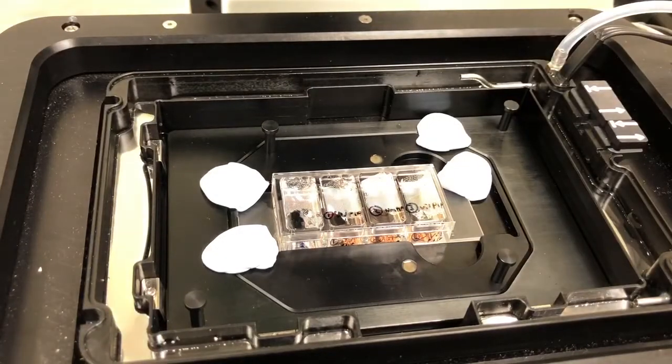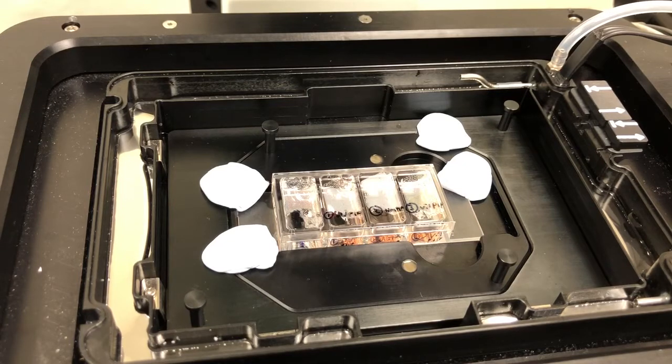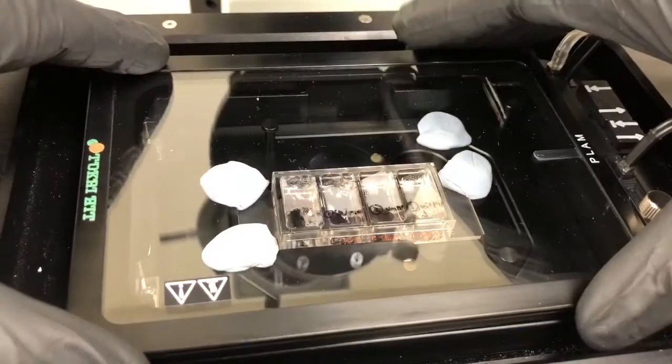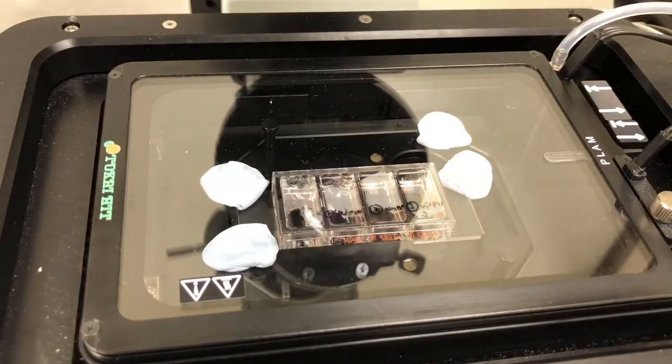Again, this is just something that will add an extra measure securing the sample so that it doesn't jostle around during live cell imaging. Let me cover this up. And so now that sample is ready to go.